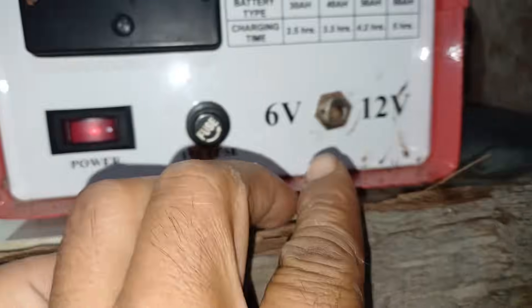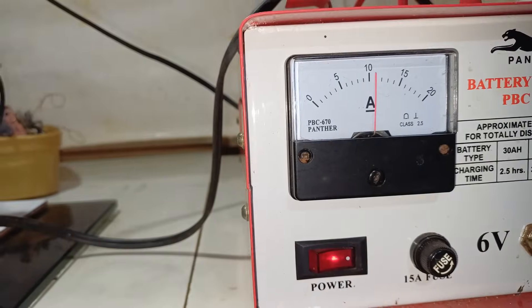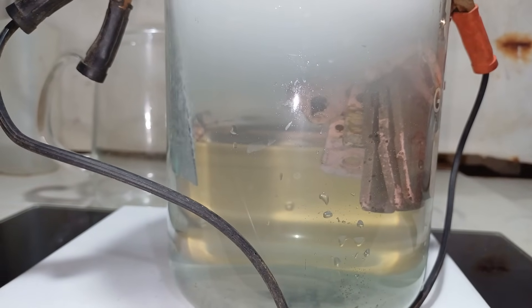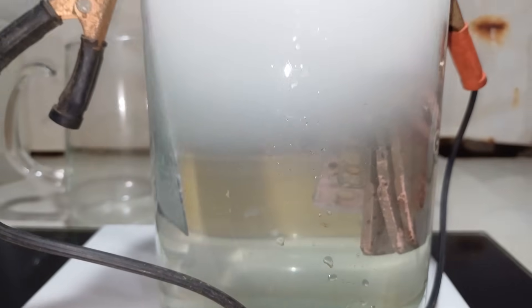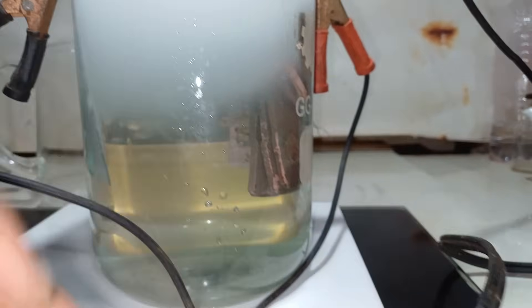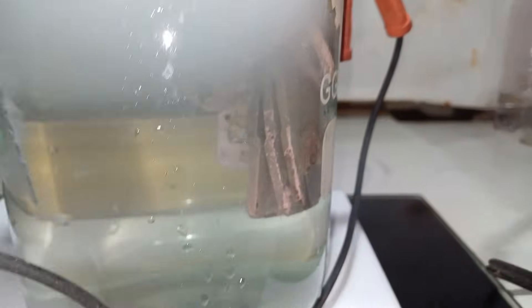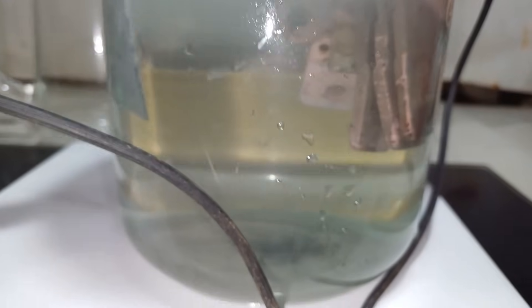This is 6 volts. But if we proceed to 12 volts, what happens? Very high amperage. We observe the temperature and voltage. Too much bubbling but our solution is cold — 10 amperes. As we can see, much more silver is falling to the bottom.